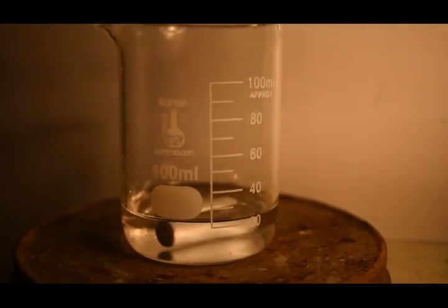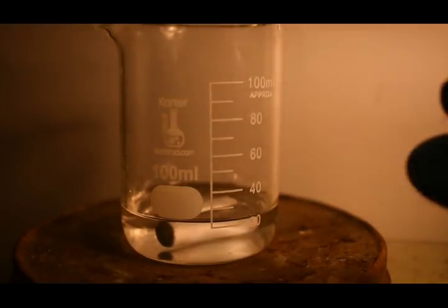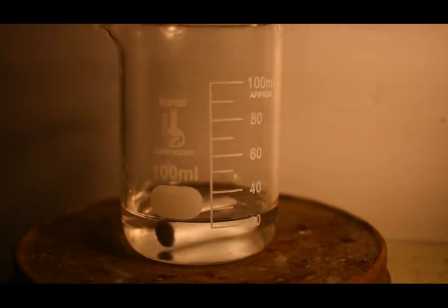What I have here is just over 20 milliliters of distilled water in this beaker. It's very important that you use distilled water with any sort of soluble silver, because if you don't and you just use tap water or filtered water, you'll precipitate out pretty much every single silver salt of whatever is dissolved in your water. Silver is really picky about the purity of what it's dissolved in, especially water.